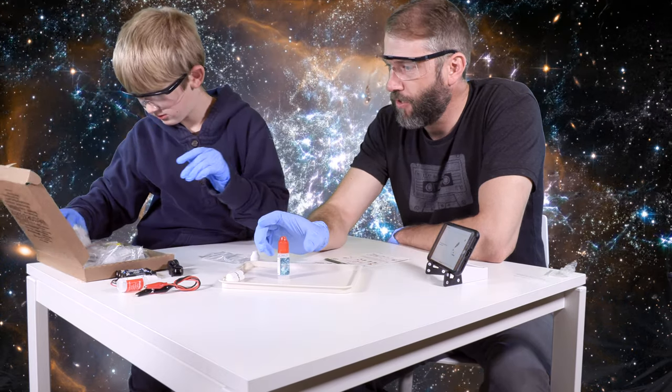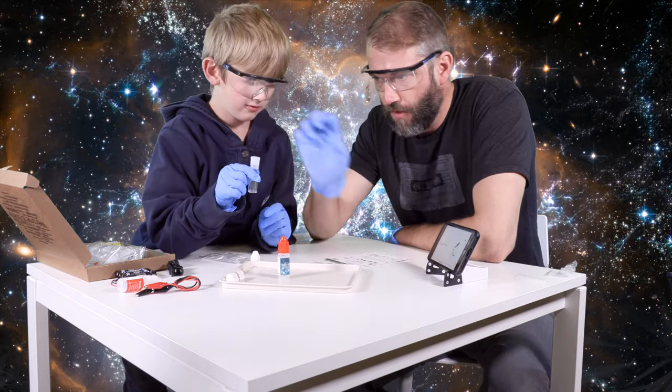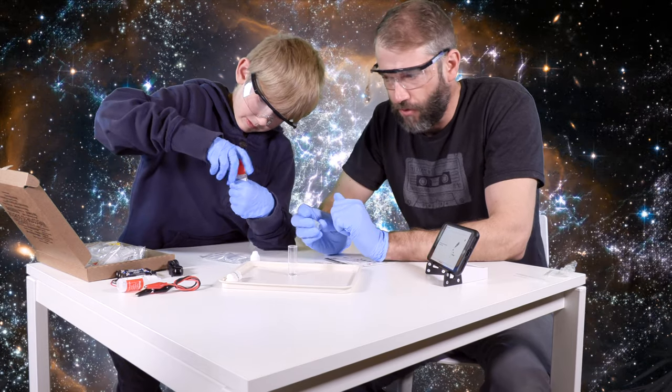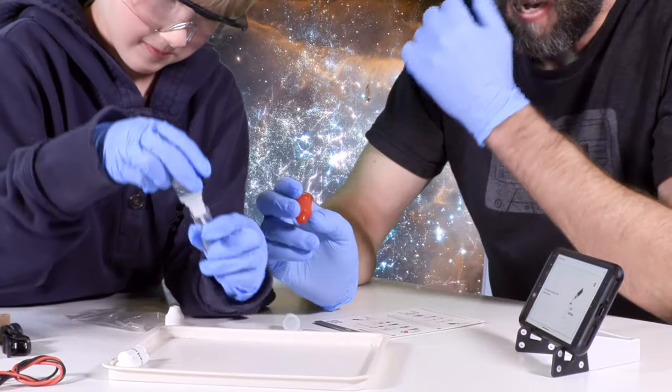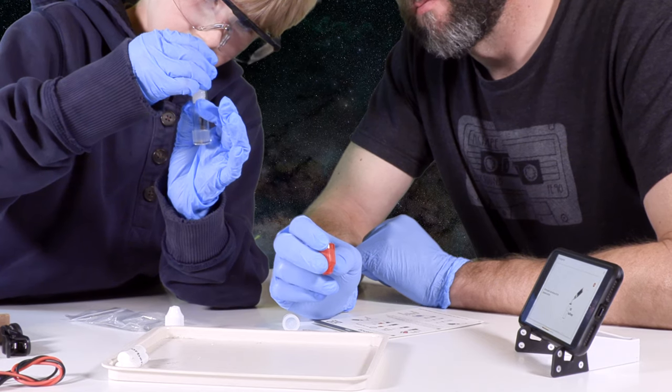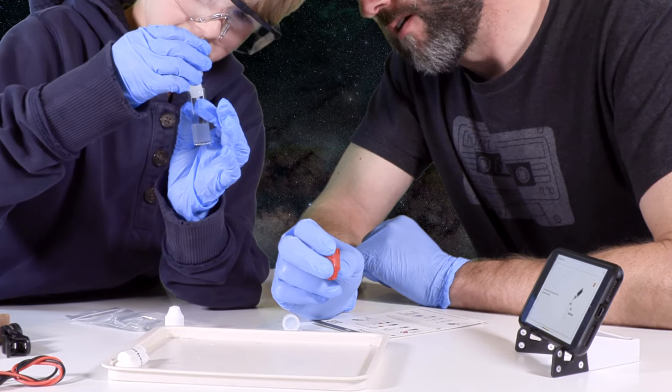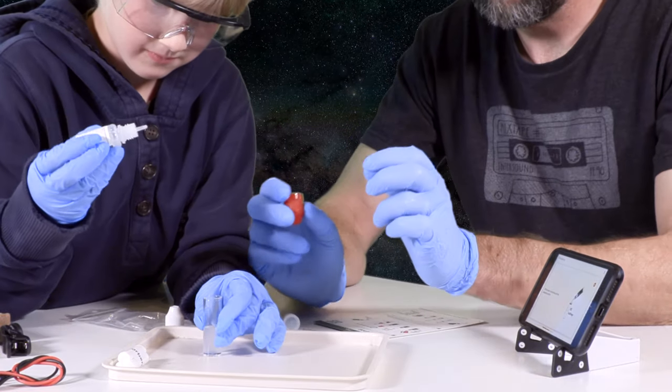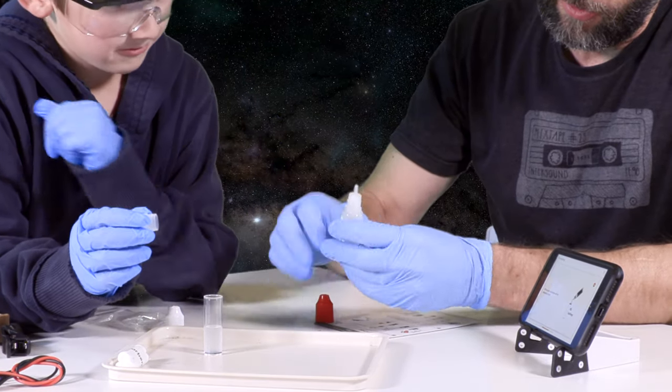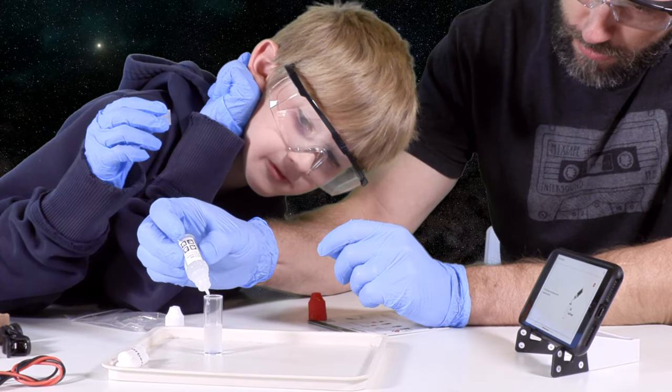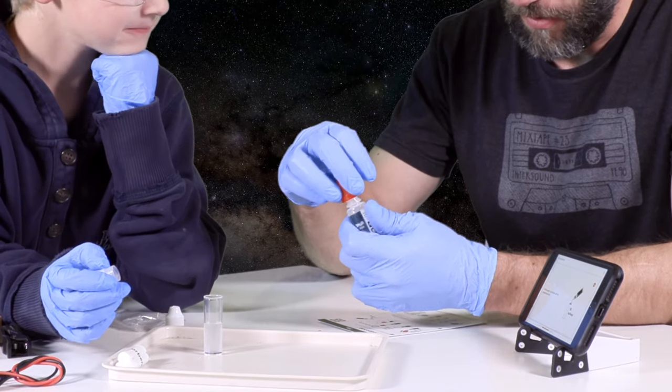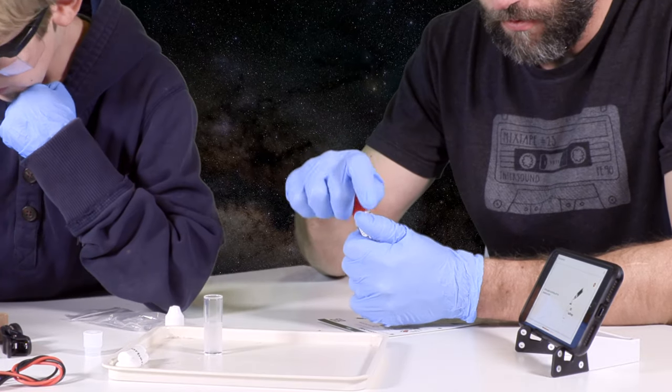So we're good to go. Now we're going to take the test tube. So we're going to take the test tube and it says to fill the test tube halfway with that solution. So be careful. Carefully fill that halfway. A little bit more. Now let's be sure to cap this back up. It looks like we have enough to do this at least one more time. Let me put a little bit more in now that I can see the thing. We're going to cap the test tube now? It does not say to cap the test tube now. Don't cap it because we're going to have to put something in there.